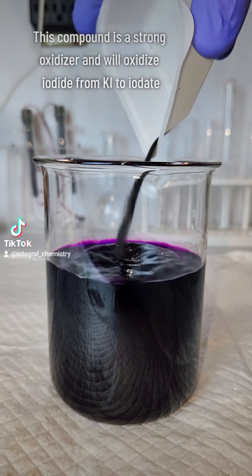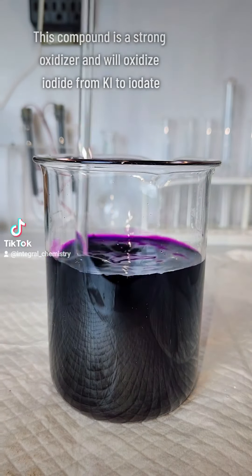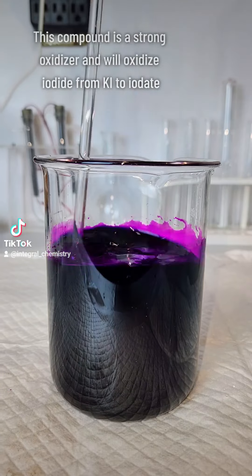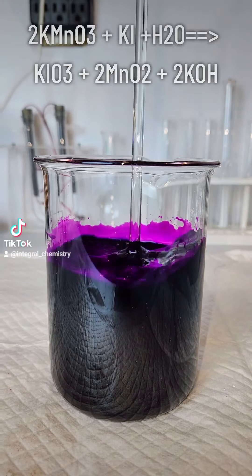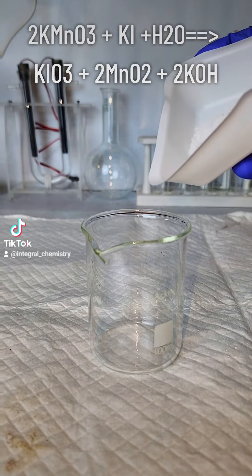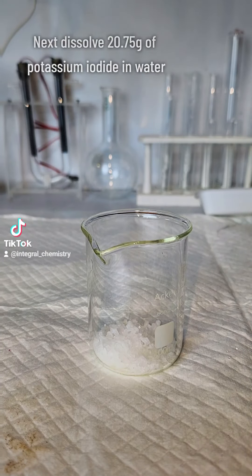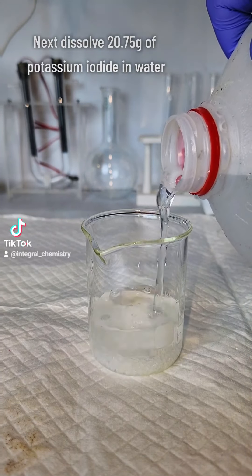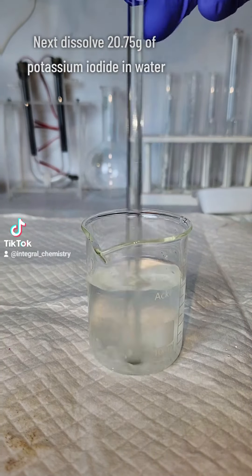To get started, all I do is dissolve about a quarter mole of potassium permanganate in about 600 milliliters of water. The potassium permanganate is going to work as an oxidizer and oxidize potassium iodide to potassium iodate.